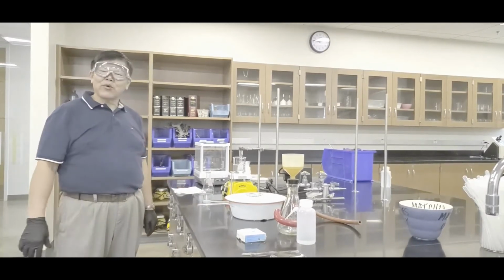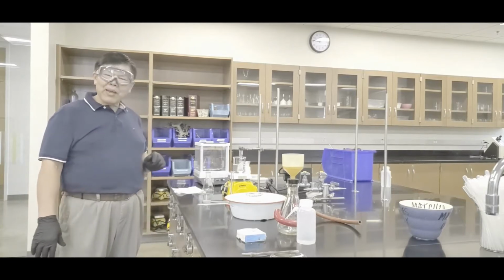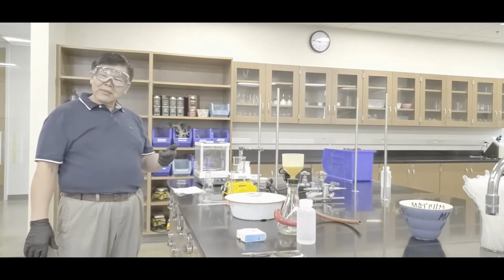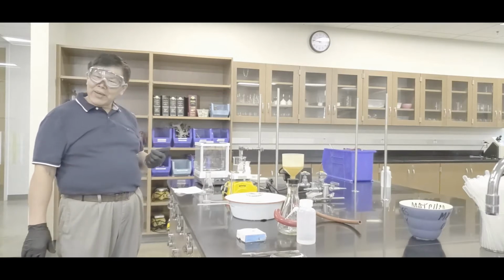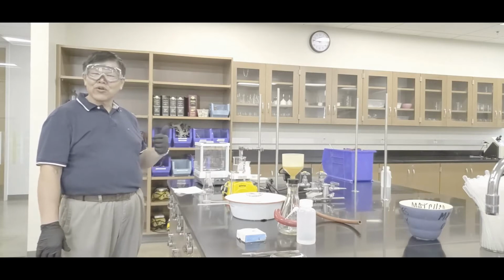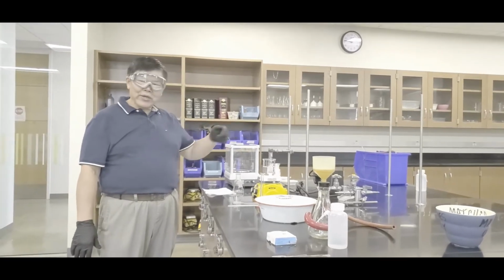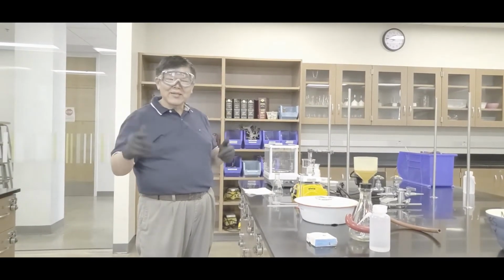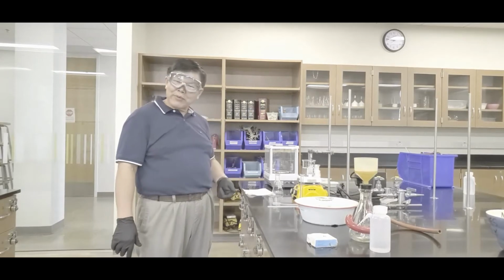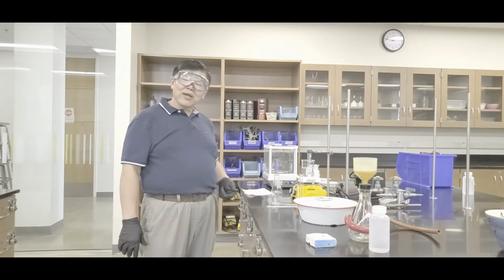This is going to be a time-lapse video in the sense that we'll let it heat up, and once it starts boiling, then you cook it for about, say, 10 minutes, okay? So your clock for the cooking starts after it boils. Typically you want to put a thermometer in here, but in Phoenix the boiling point is about 98, so that's why I didn't bother to put a thermometer there, okay? When it starts boiling and cooking, I'll come back, okay?